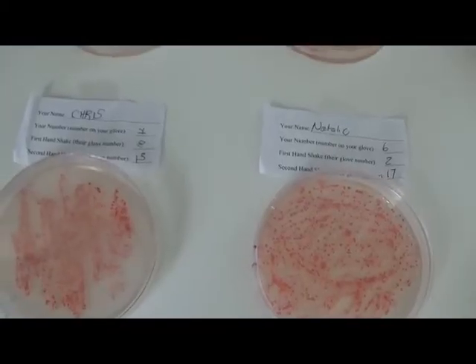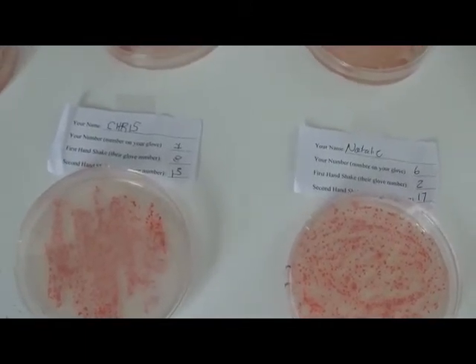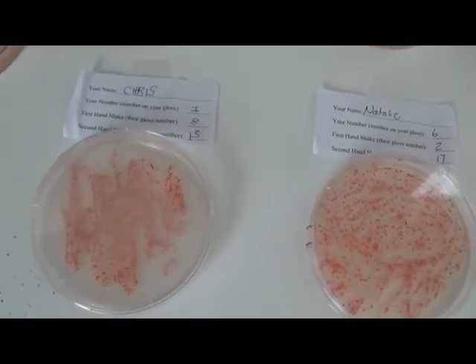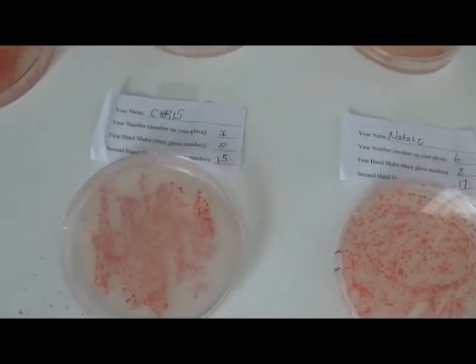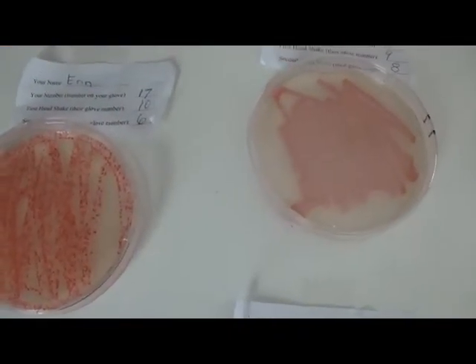Each dot represents one single bacterium that was on your plate that divided asexually so many times over and over and over again that it's big enough for you to actually see on the plate. And so you're counting those dots, and each one of those dots represents a bacterial colony, and that's going to be how you determine the spread.